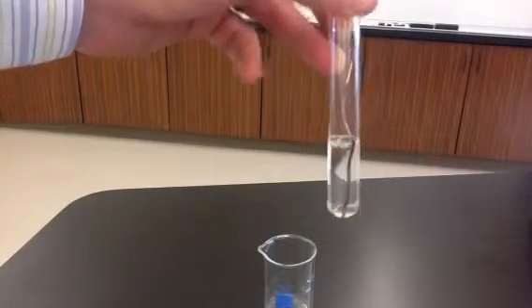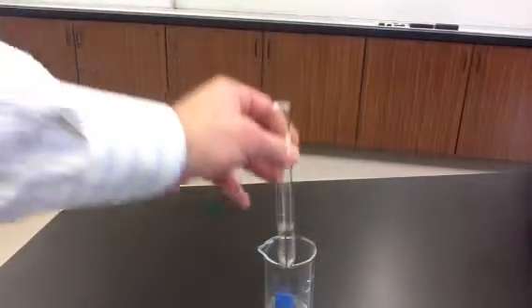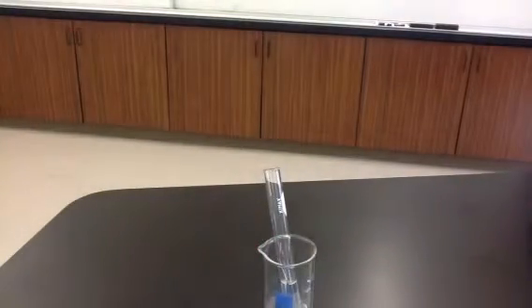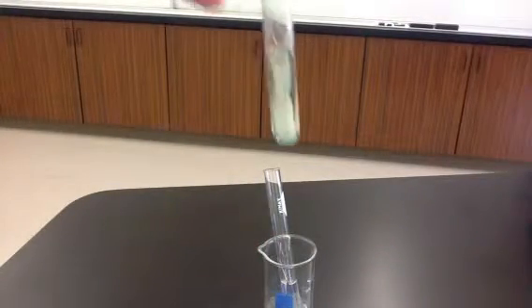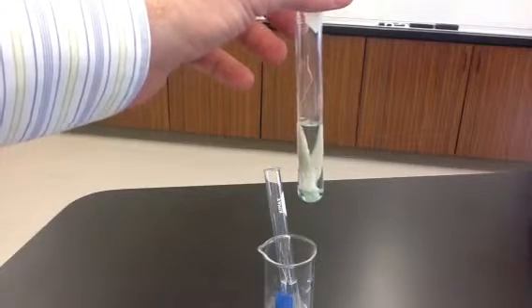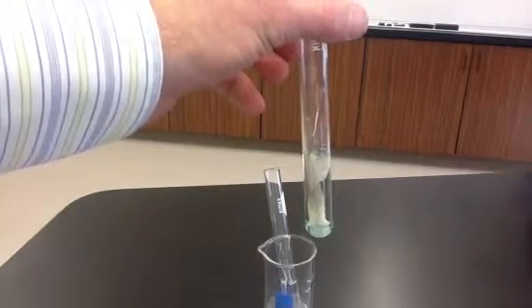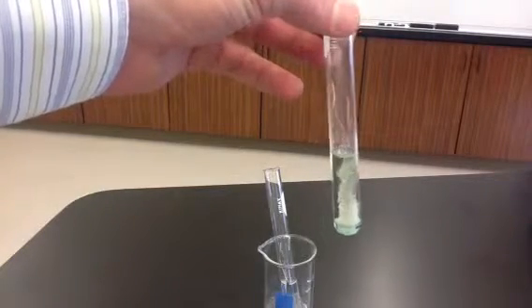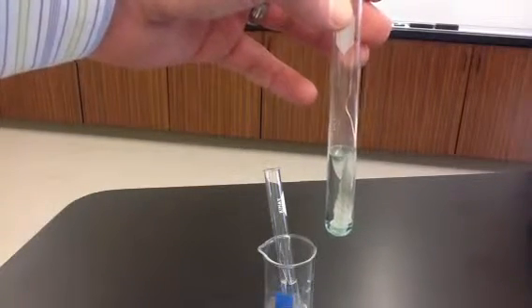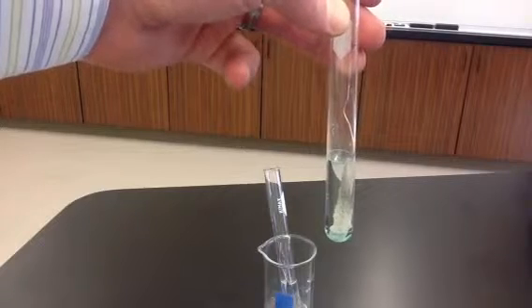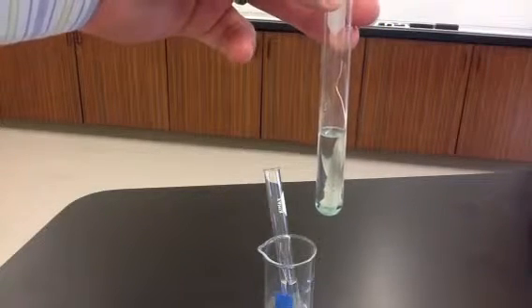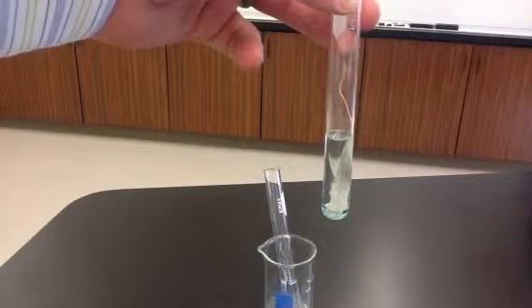I have one of these that I started a few minutes ago. And over time, it will start to look like this. So on this one, you can see that a lot of silver has come out of the solution. You can see these big crystals of silver that are now coating the copper wire. You can also see that the solution started to turn a little bit blue.